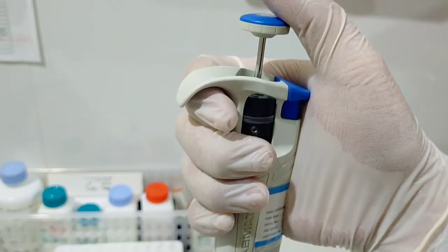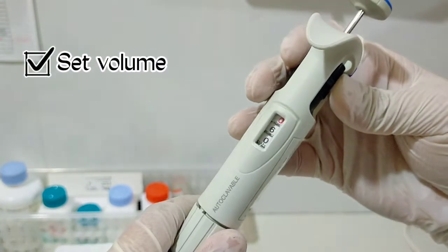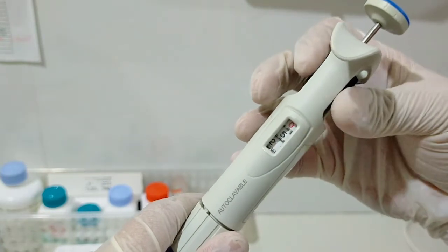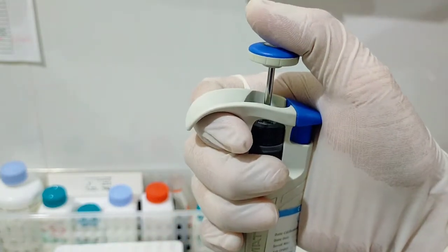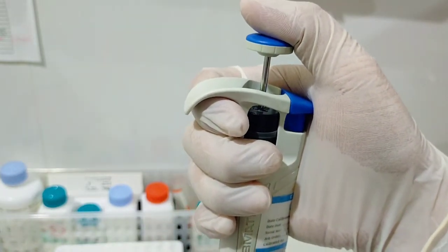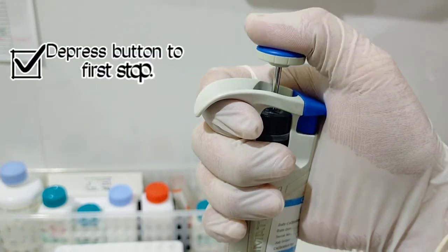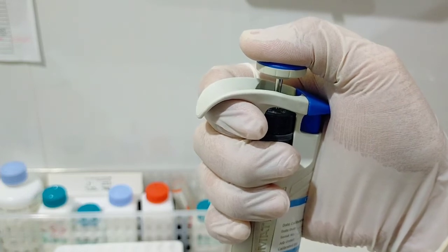Let's begin by setting the desired or required volume. Let us assume 500 microliters. From the rest position, you press the button until you reach the first stop. After you reach the first stop, you must release to aspirate.